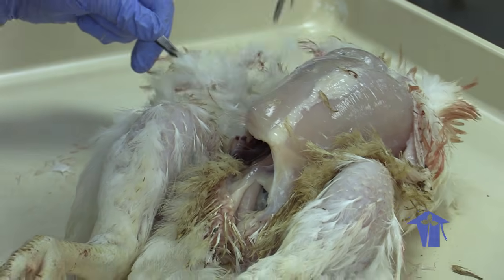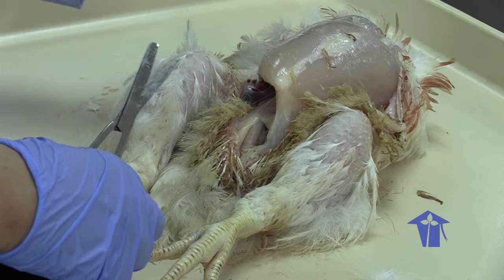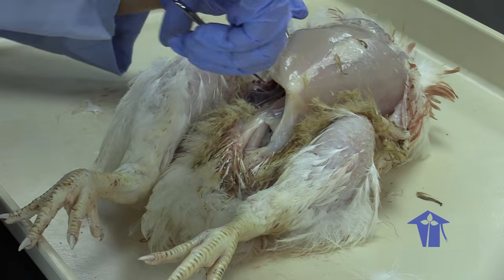Oh. So this guy has had a very, very big meal recently, and we'll talk about that in a little bit.